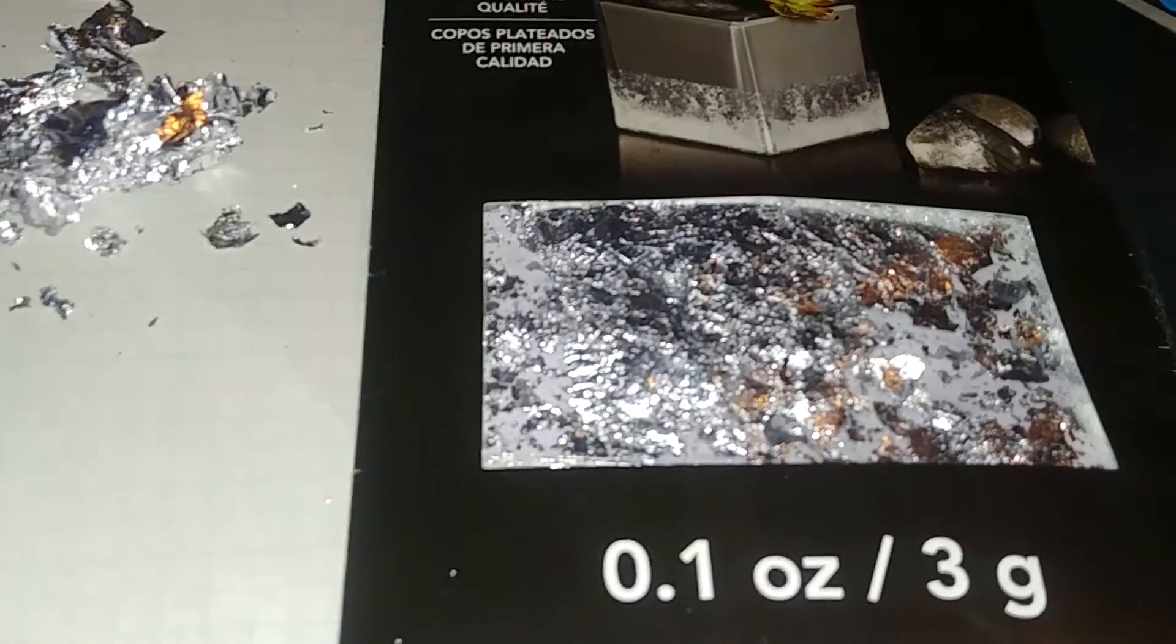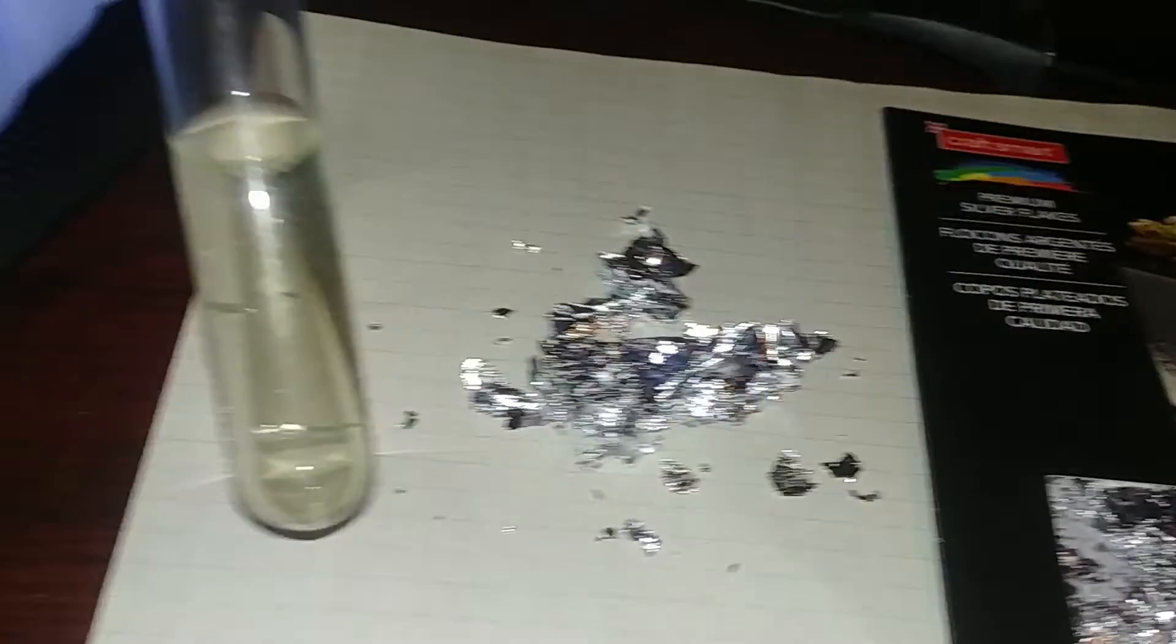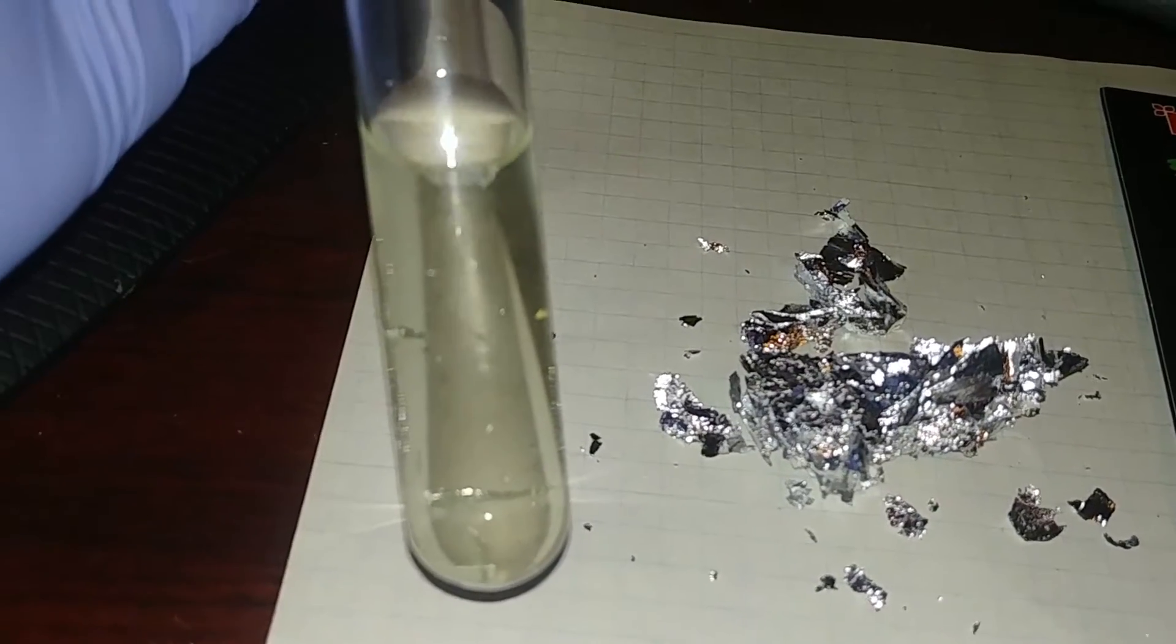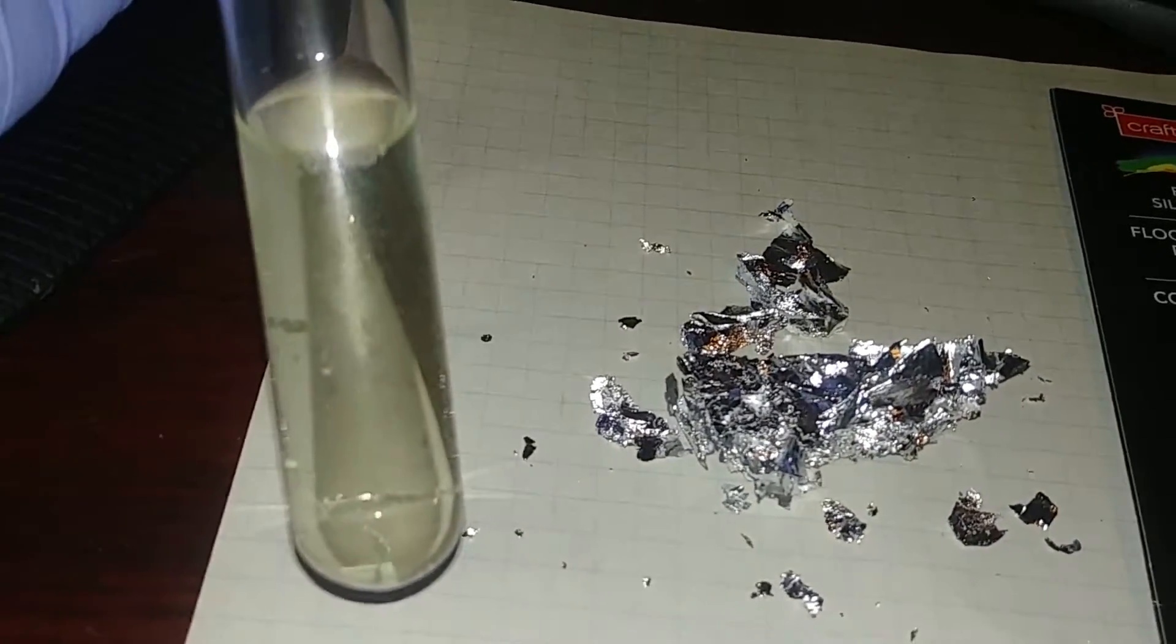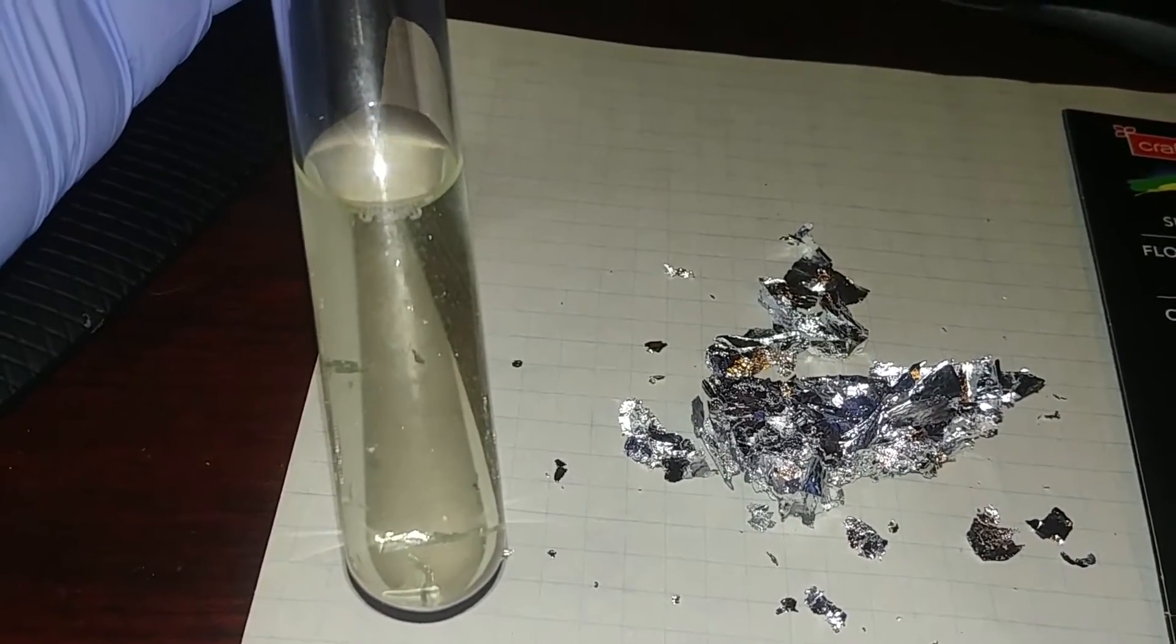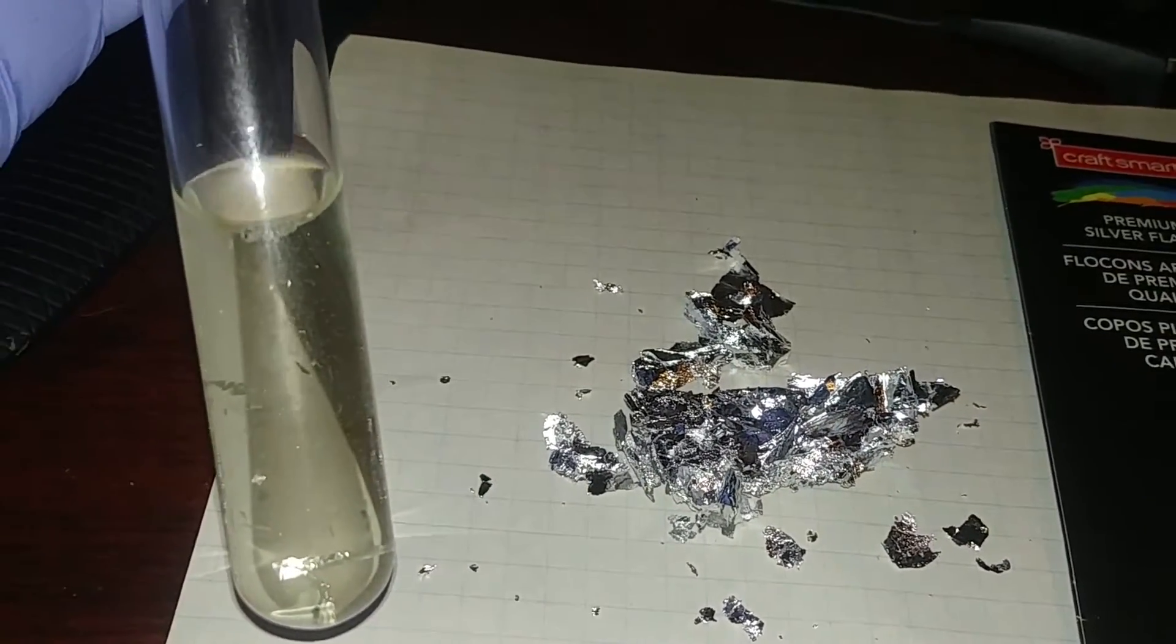So what I'm planning on doing is I'm going to continue to dissolve. Yesterday, like I said, I put this approximate amount in this test tube. So it filled up this whole area here. And at first, I didn't think it was going to do anything. After like 20 minutes, there were still no bubbles. I also did not have this on heat.